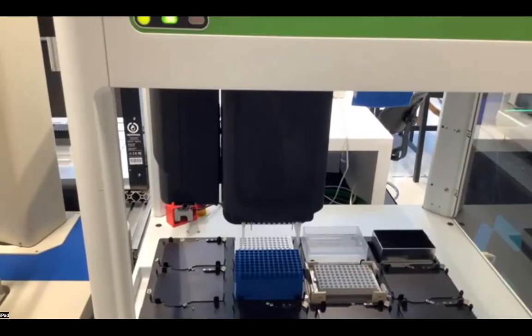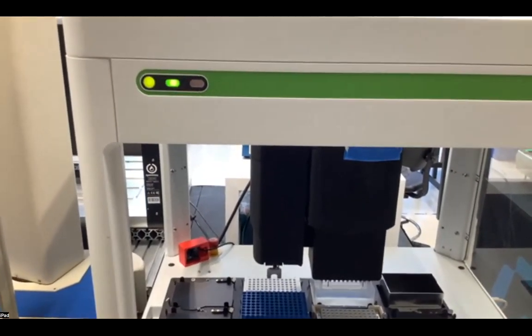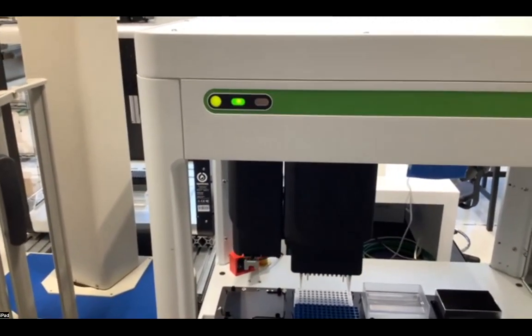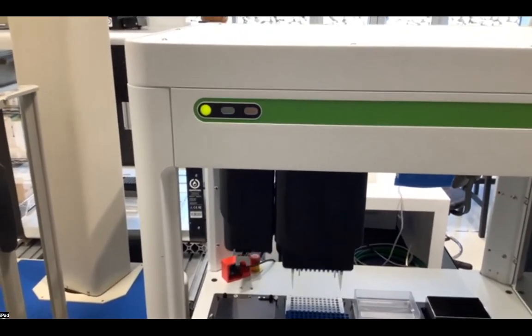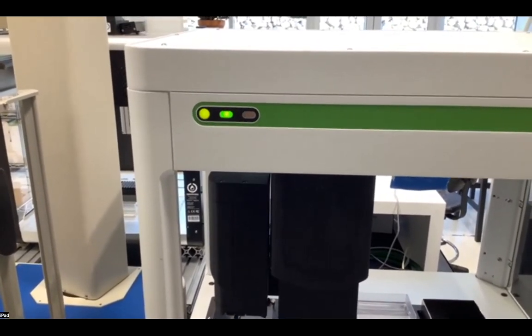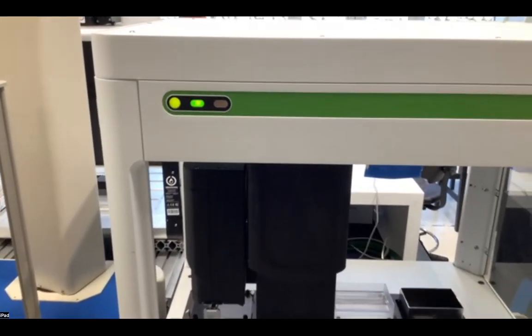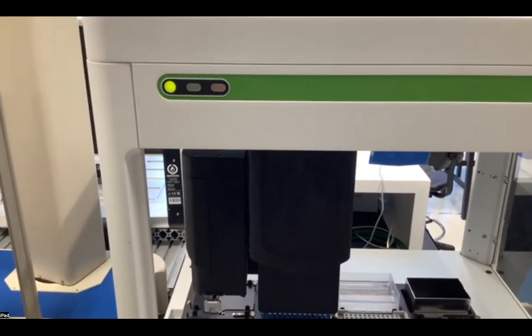So again, if this is going to be a command that you are going to run frequently, you can have this specified as a drag and drop so that your end user does not have to see any of the code that you've put together, and instead only has to run a singular command. And you still have the ability to leverage our run tracing, run accounts, user management, and easy to understand UI for all of the features that you have just provided a complex bit of code for.